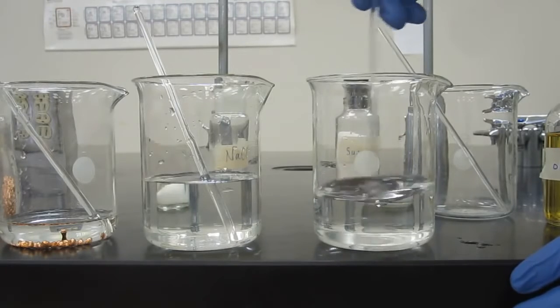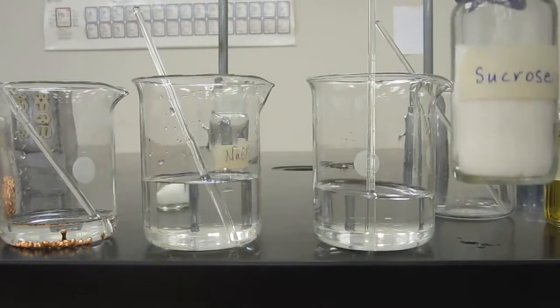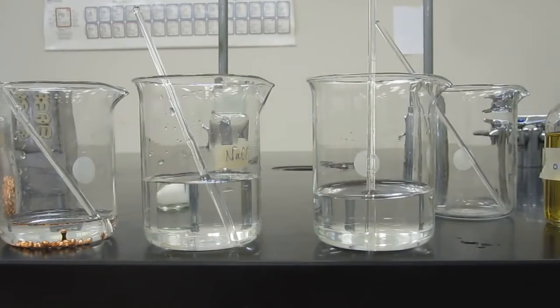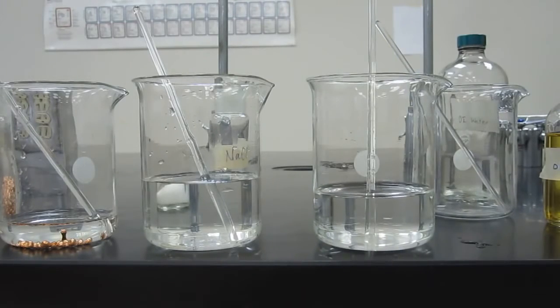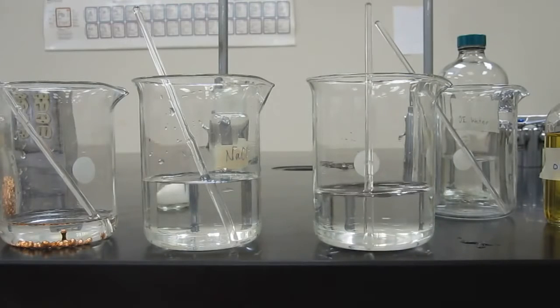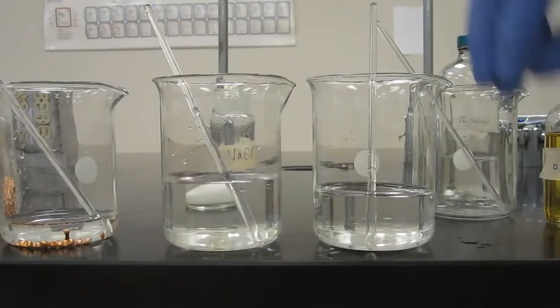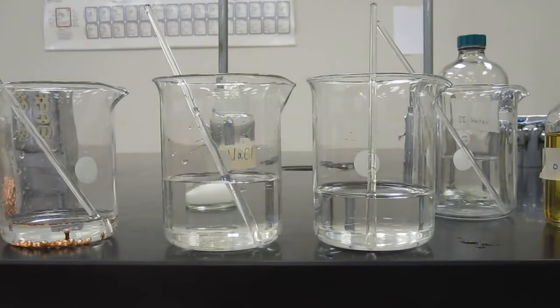And that's due to the chemical structure of them. They're both molecular solids that are polar. So sucrose is very polar and water is very polar. Both molecular solids. You'll learn more about that later. But you can see, right, we mix them up, and again, just like this one, you can't really see the sugar anymore. You can't see it at all. But if I were to taste it, it would be sweet. So it still has that property of sugar.